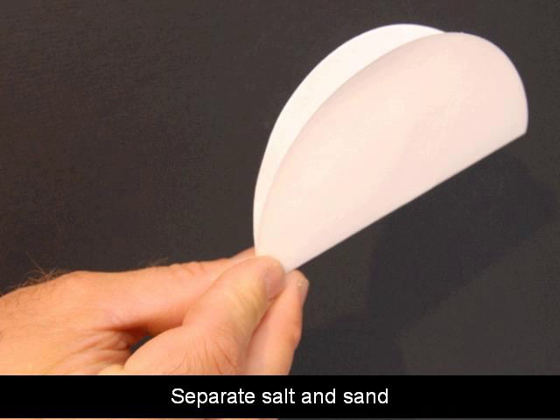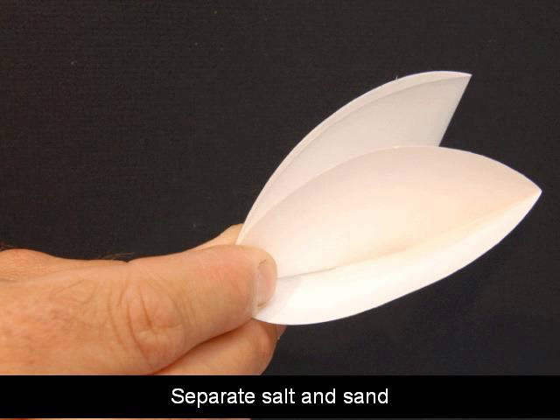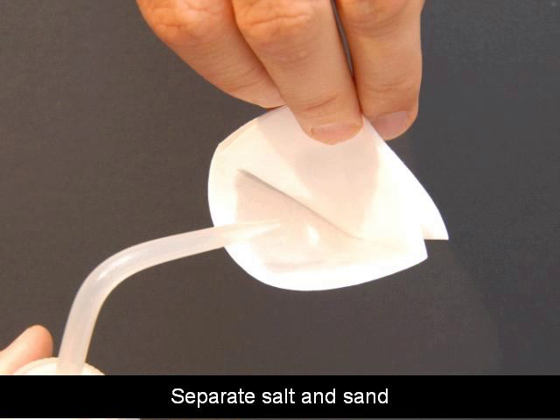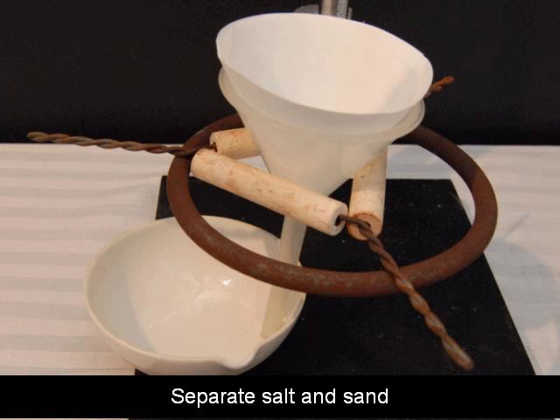So we can dissolve it, filter it away and separate it out. You'll need to get your filter paper folded in half. Fold it in half again. And take one, two, three of the edges and pull them to one side. This area right here is where you'll put your salt and sand mixture. First though wet down the filter paper with a little bit of water. That helps it stick to a plastic funnel or glass funnel. And make this set up like I have here with the iron ring and the ring stand, clay triangle, funnel with filter paper in it.